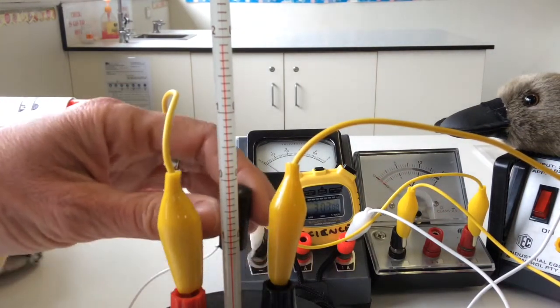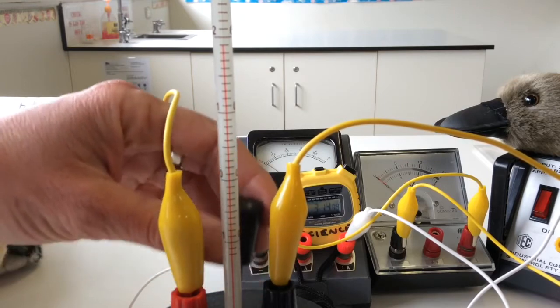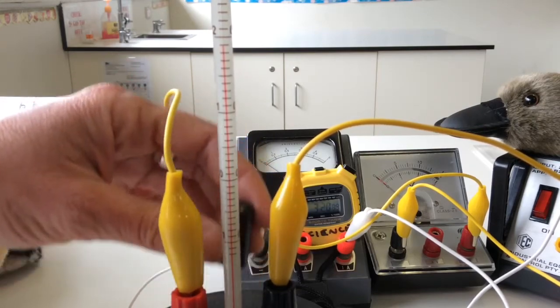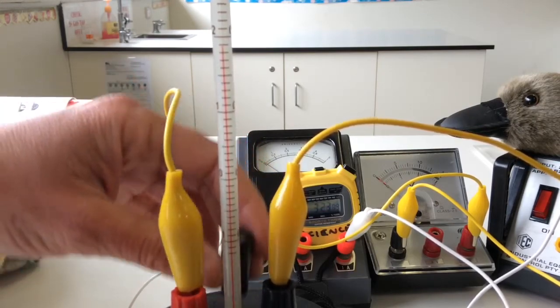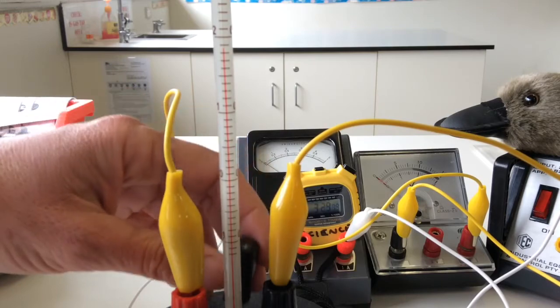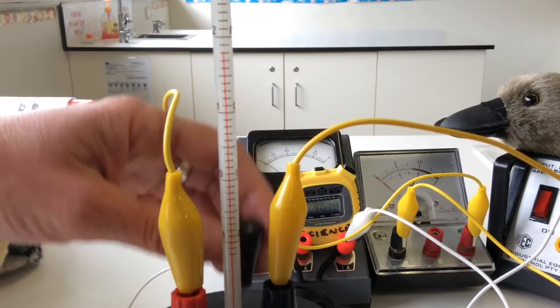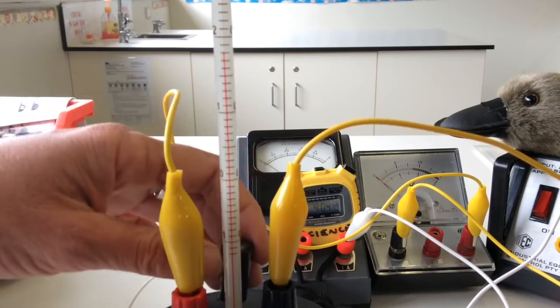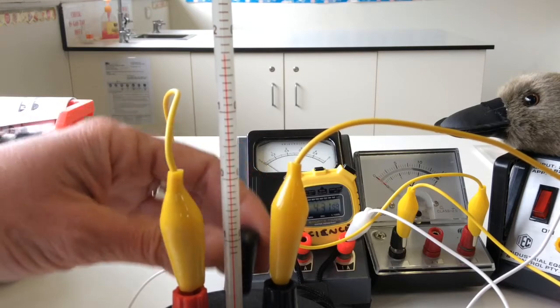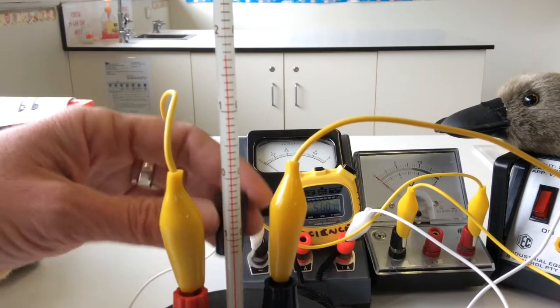I'll turn the power off, but I have to keep stirring. This is where we test to see how well the calorimeter is insulated. So you need to record the temperature again now for another three minutes while the power has been turned off. Okay, that's the first 30 seconds of the power being turned off. Another 30 seconds, so that's a minute 30. Another 30 seconds, that's two minutes.